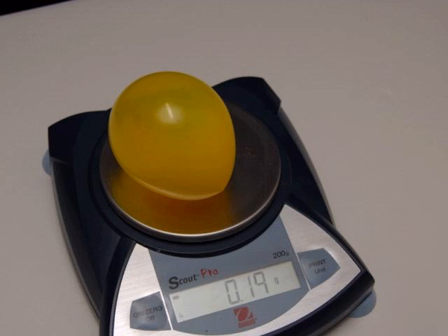And when it seems like the reaction is finished, then go ahead and take the balloon off and tie it off and weigh it. And look at this, the mass of the balloon increased. Now remember, we can't measure mass directly. We have to measure weight of something.